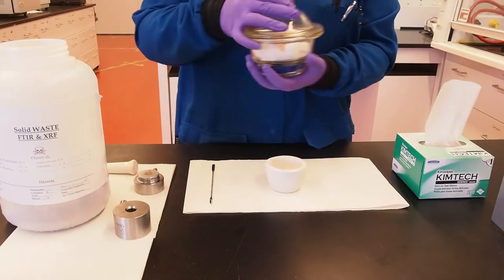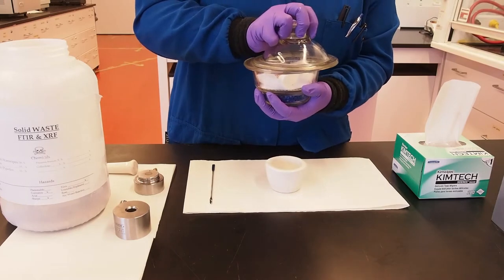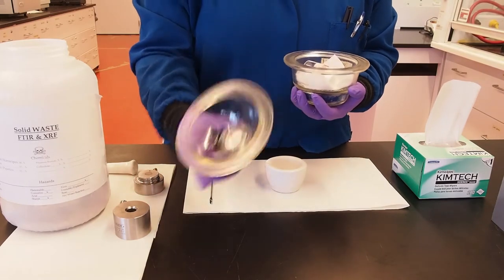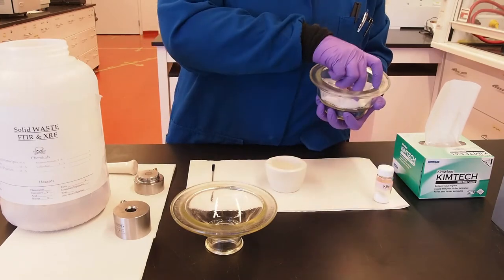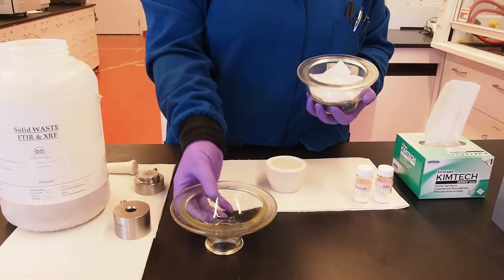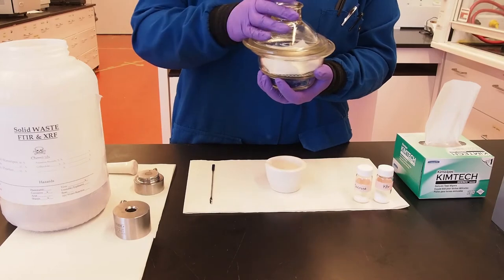For demonstration purposes, we are using a ceramic mortar and pestle. Often for laboratory use, an agate mortar and pestle are used. Agate is a non-porous material which is easy to clean and therefore helps to reduce contamination.